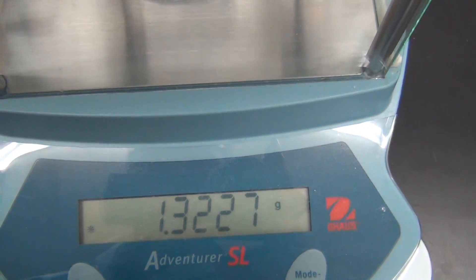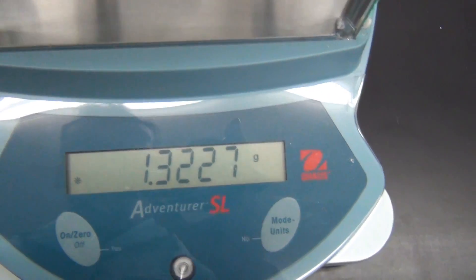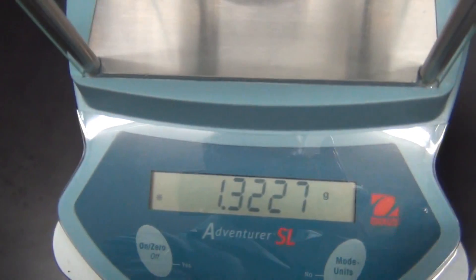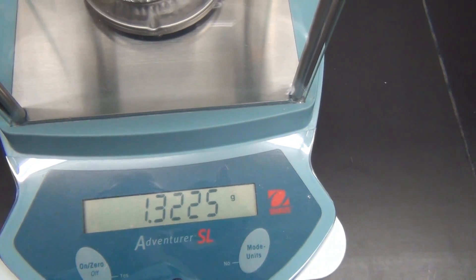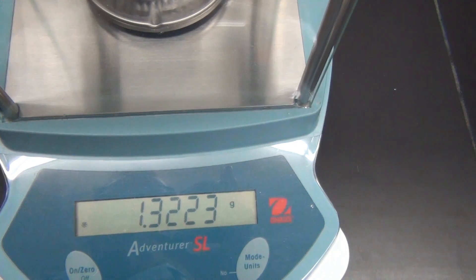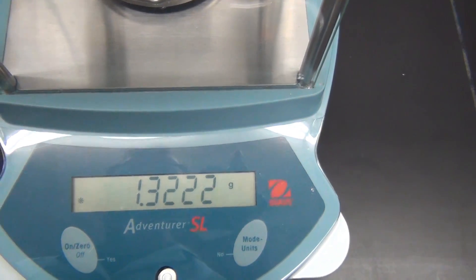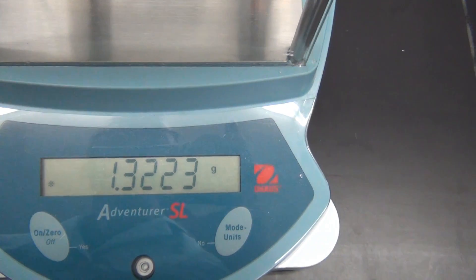And it basically works the same way. If you don't close the doors, this instrument is so sensitive, it will actually measure the air blowing across the balance, as you can see by the weight constantly changing.